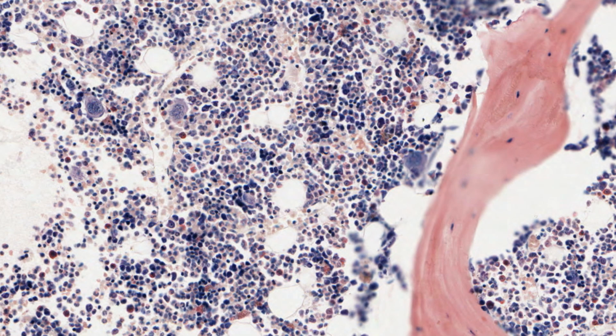This section of tissue is from a monkey and retains the structure of the bone marrow. You can now understand that it's much more difficult to identify particular cell types in sections other than in smears, which is one reason that all serious hematology is carried out examining a blood smear.